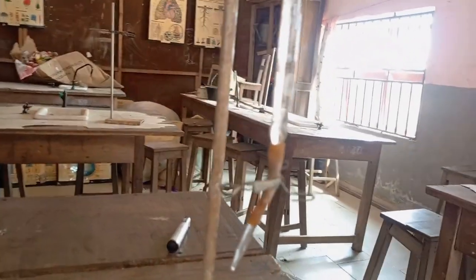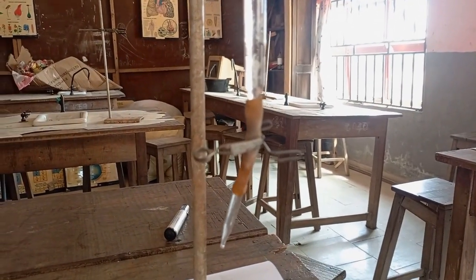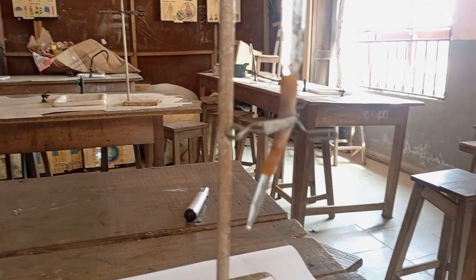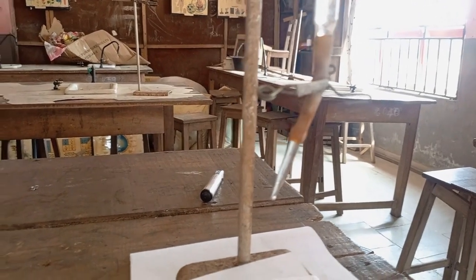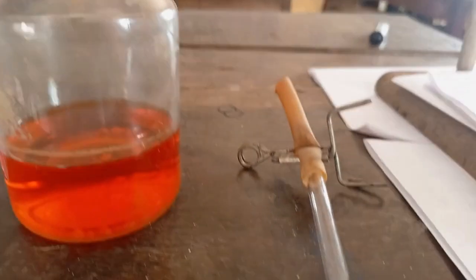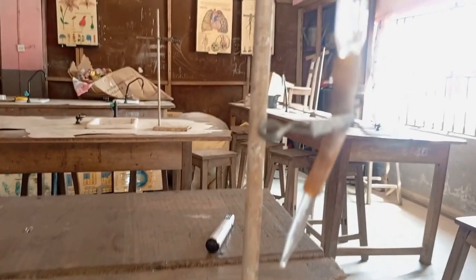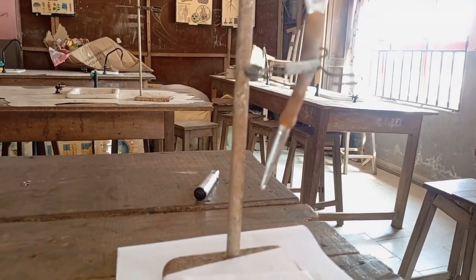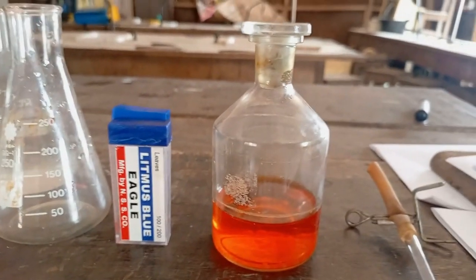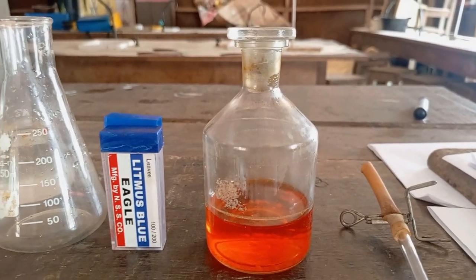And then the burette is of two types. We have the one with a clip that is clipping a rubber pipe, which is going to be the nozzle where you control how you dispense the content of the burette. Then this pipe, look at it here very well. I just have another one. Another type of burette is the one that has a tap where you can easily lock or unlock it while dispensing the content. Then here is a reagent bottle containing my indicator, my methyl orange indicator.